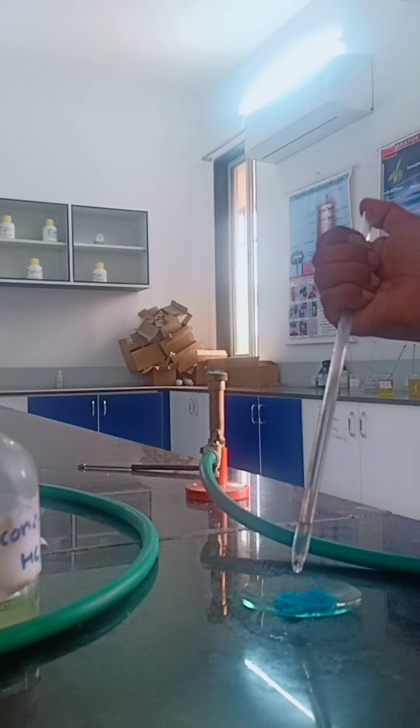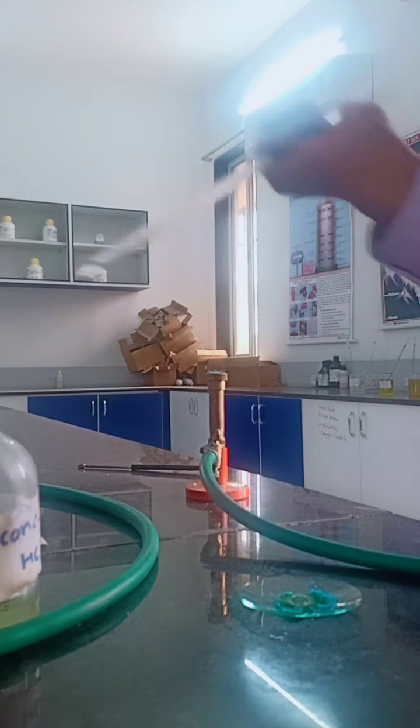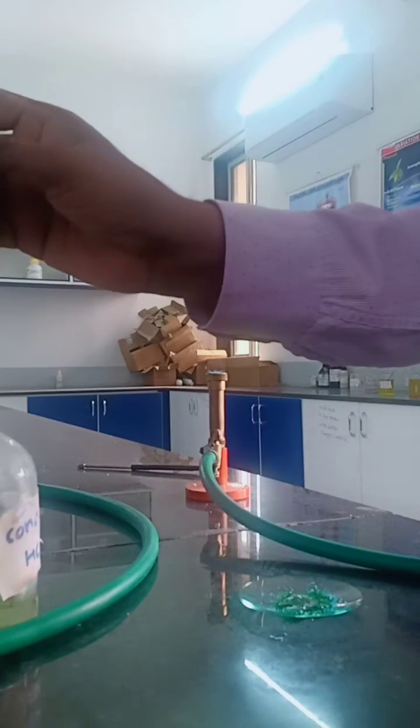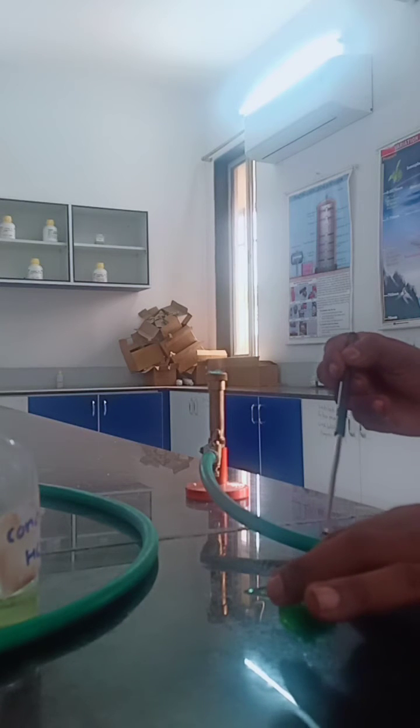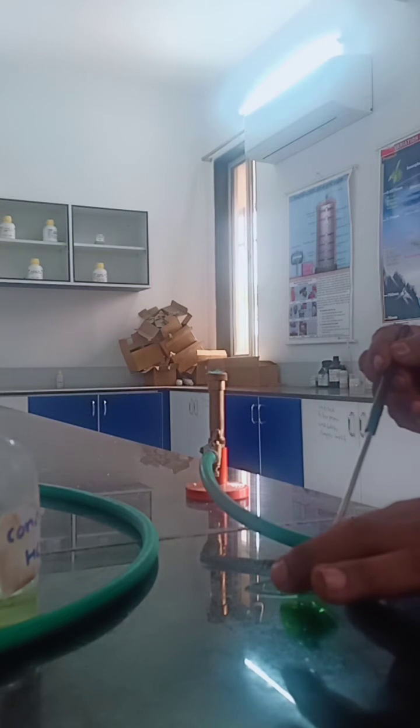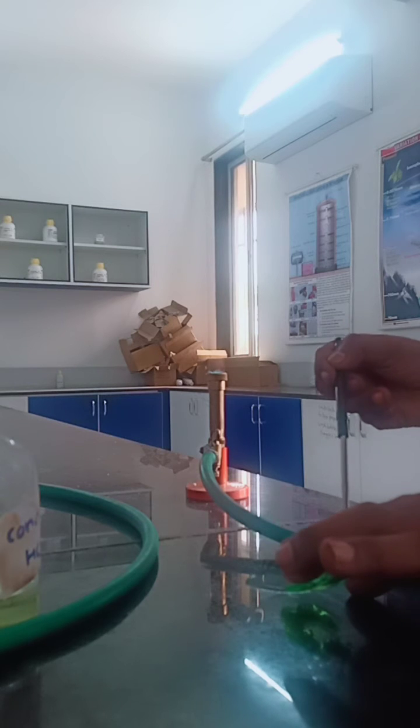Adding a small amount of concentrated HCl to make the paste. Now take this paste on a loop - take this paste on a platinum wire loop.